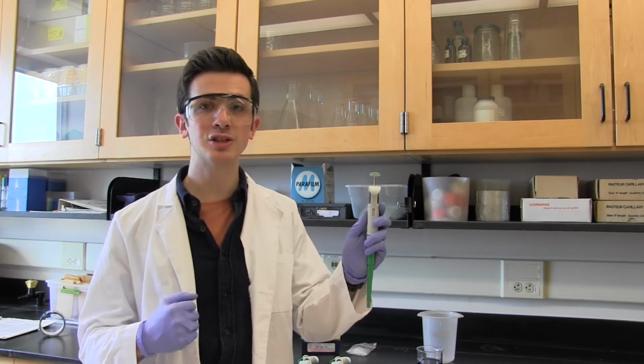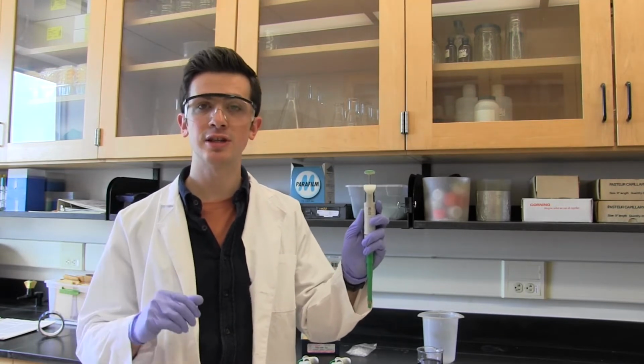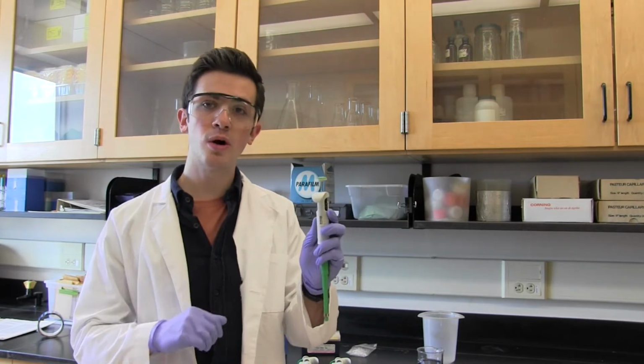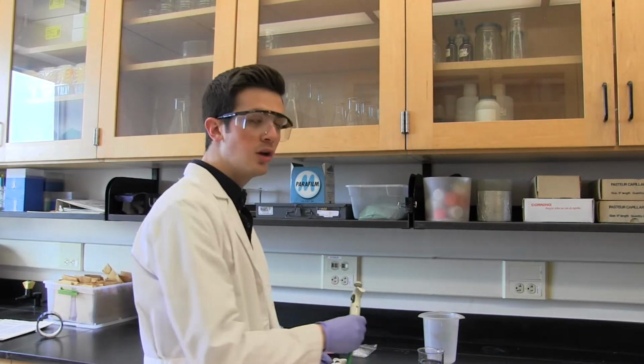These are all examples of measurements that will have a small degree of inaccuracy introduced into them just because you're using the wrong pipette. If you need to make highly accurate and precise measurements at those intervals, use a second pipette in addition to your first. Using the 100 to 1000 microliter pipette, as well as a 0.5 to 10 microliter pipette, will allow us to have the highest degree of accuracy and prevent introducing accidental errors into our experimental design.